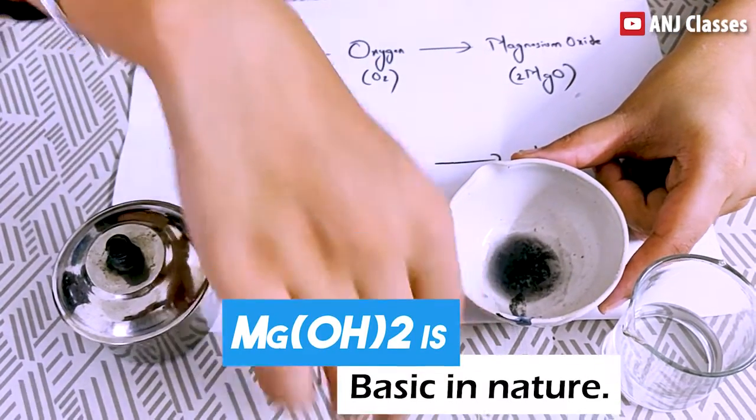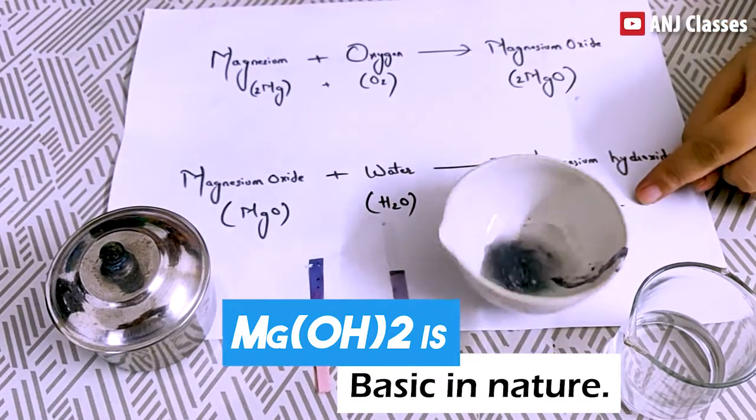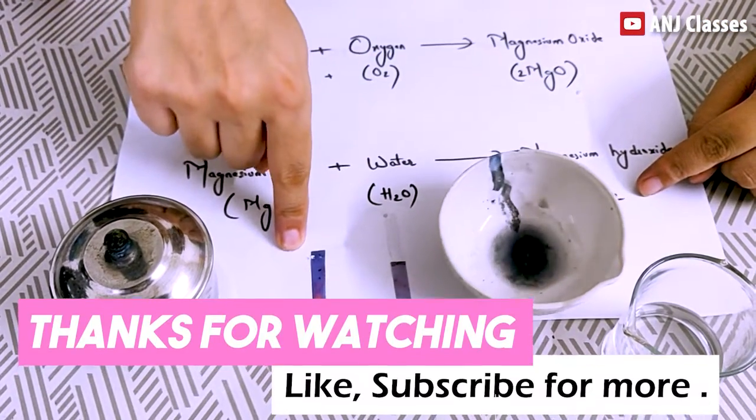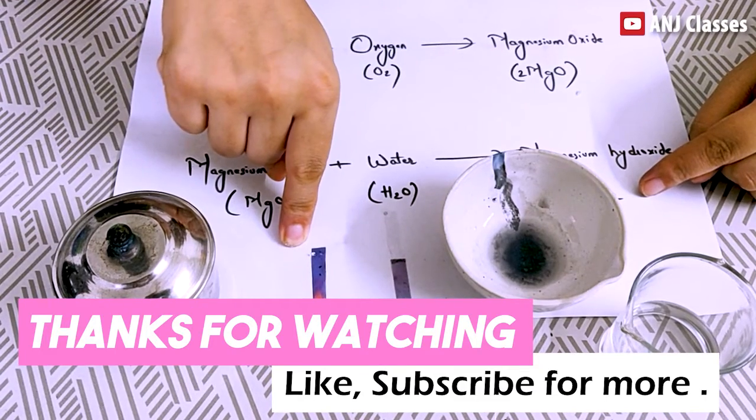So what it indicates? It indicates that magnesium hydroxide is basic in nature. Thank you students, hope you enjoyed this activity.